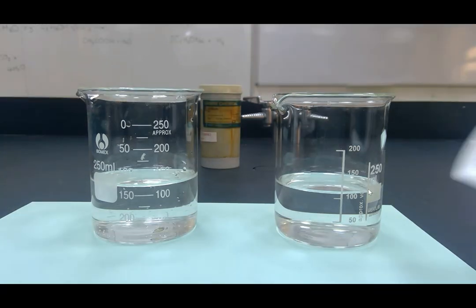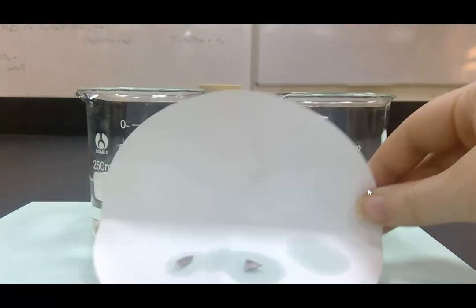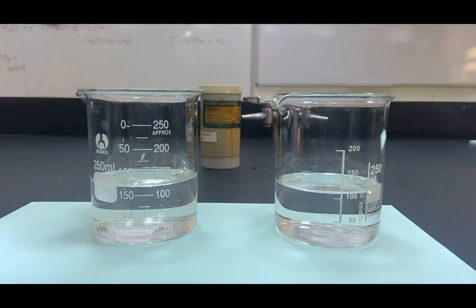So I've got 2 approximately equal size pieces of sodium. As you can see, they're much smaller pieces of sodium than you have probably seen when your teacher has demonstrated this before. That's because I'm doing it in a beaker rather than in a large dish like you have seen before. I'm doing that because I don't want to waste a lot of ethanol by filling a big dish full of ethanol. Obviously, it's fine to fill that large dish with water because we can just get water out of the tap, but I don't want to waste equipment, so I'm doing it in a little beaker. That means I've also got to add less sodium because otherwise it's potentially hazardous.